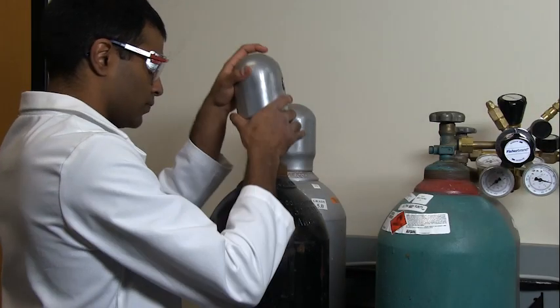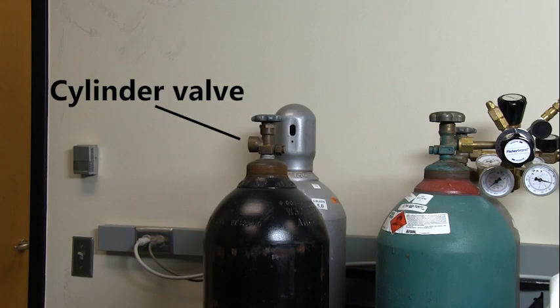Remove the cylinder cap. Remove debris from the cylinder valve.